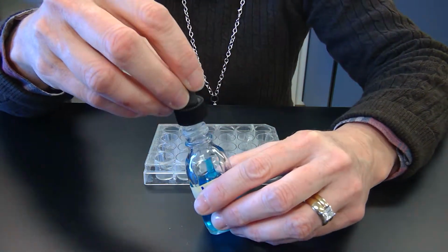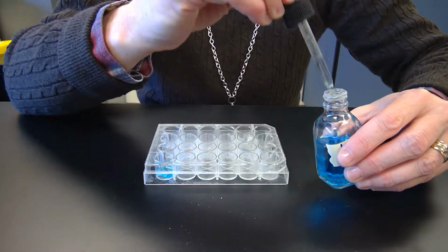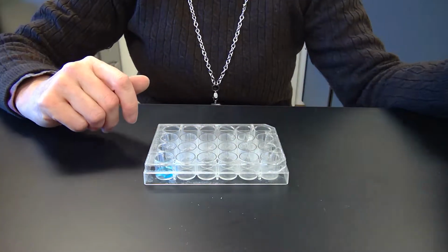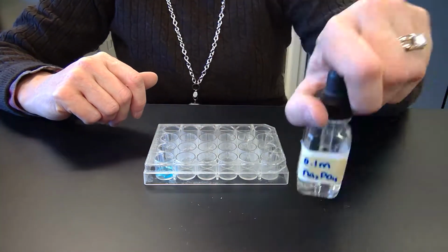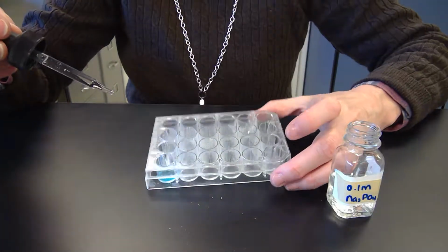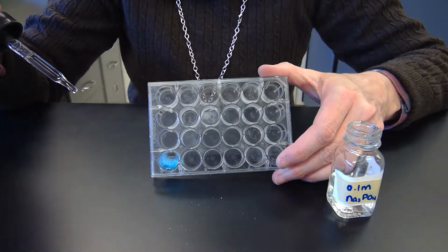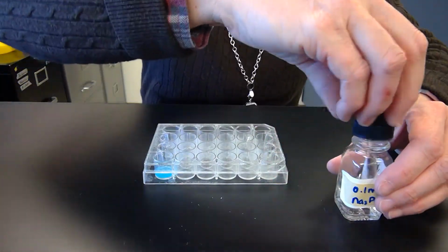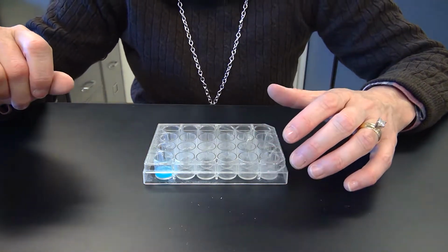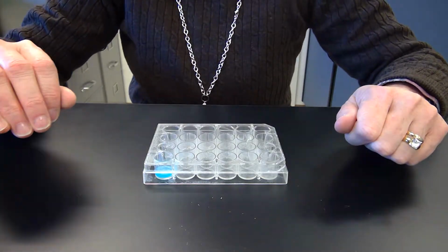So this is copper 2 sulfate. Copper is almost always blue. So there's copper sulfate, and then the next one is sodium phosphate. I'm going to add that in and we'll see what happens. So far it's a clear blue. I'll add a couple bits, and if you can see, it got cloudy. So that is a precipitate. One of the products would have been not soluble on the solubility table, so that is what just precipitated. You need to figure that out on your own.